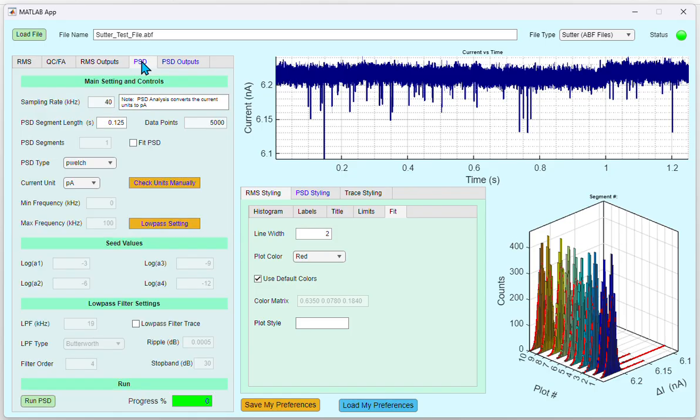In here, you can see the sampling rate and the PSD segment length. By default, the program expects to have a minimum of 5,000 data points. The PSD segments field is enabled if you click the Fit PSD. This is the number of segments you want to use from the trace to do the fitting. If you set this to 10, the program will automatically extract 10 segments from the trace, whose length is dictated by the PSD segment length, and do the fitting using one of the 2 PSD options shown in the PSD type drop-down menu.